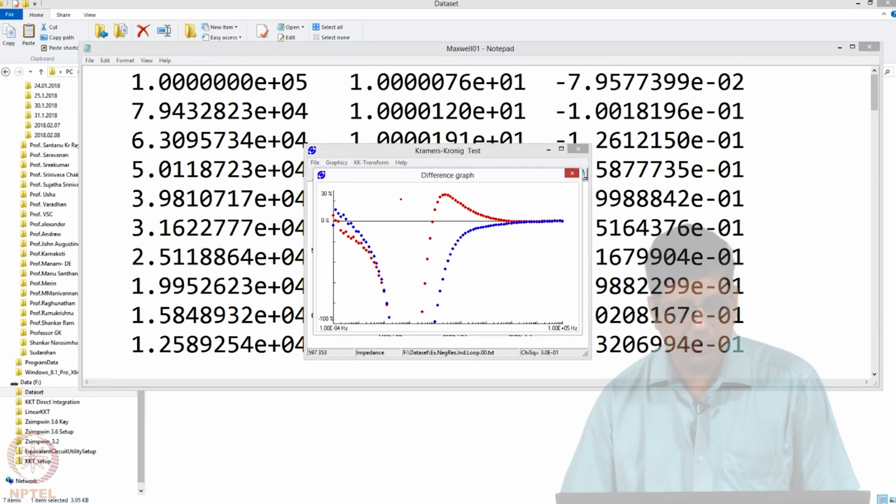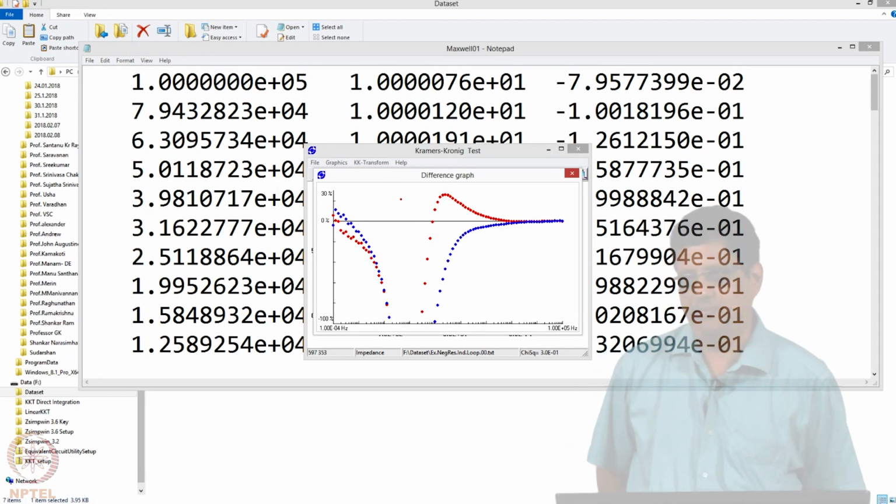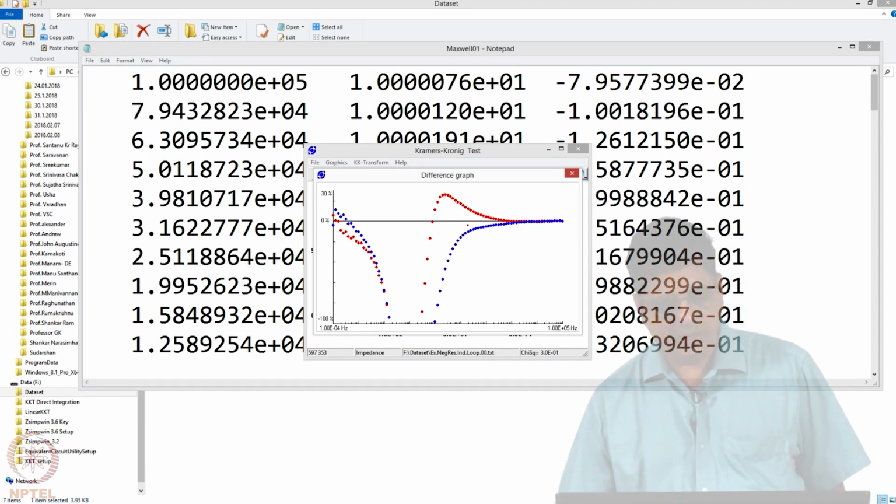it is ugly. Residuals are very large and they are not random, they are systematic. The red and blue, one of them represents the residuals in the real and one of them represents the residuals in the imaginary.